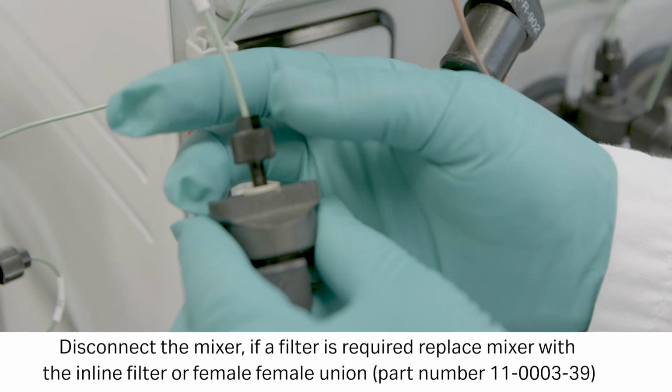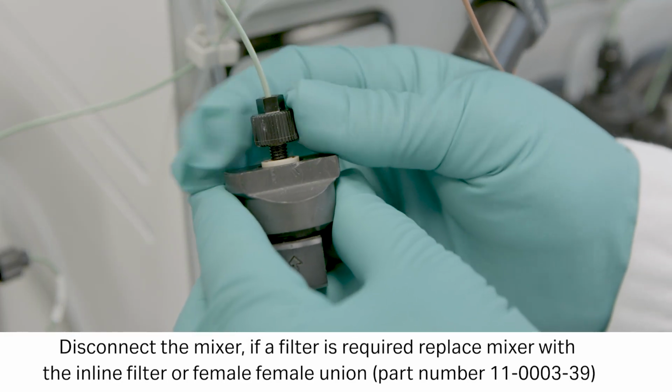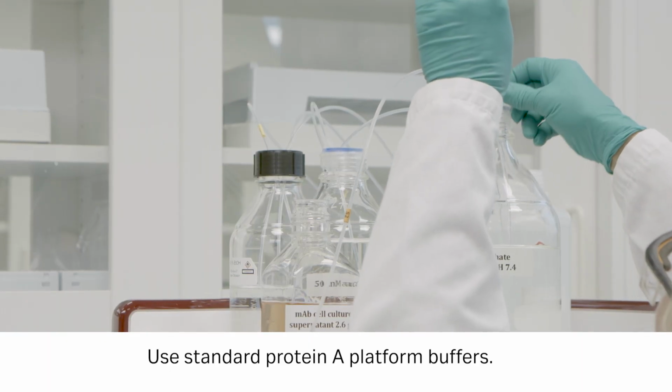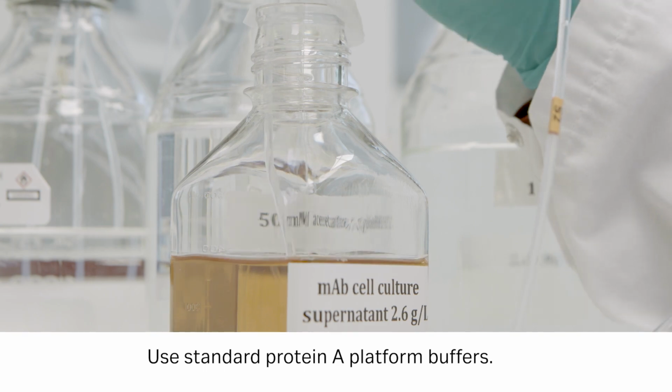Minimize the system dead volume by disconnecting the mixer chamber. The inline mixer can be replaced with an inline filter as shown here, or with a female-female union.